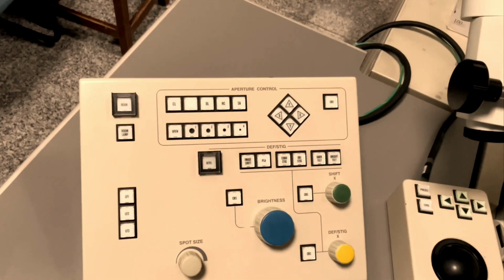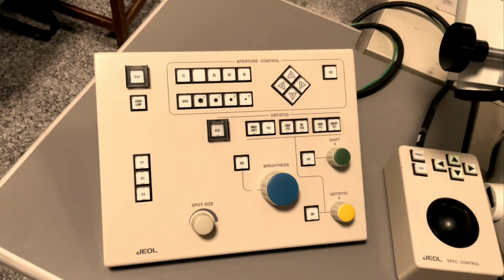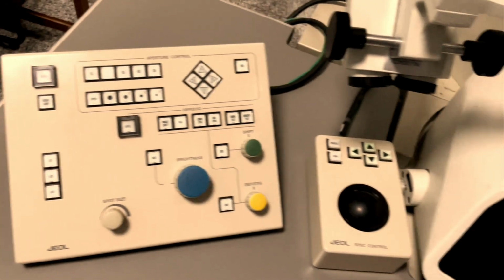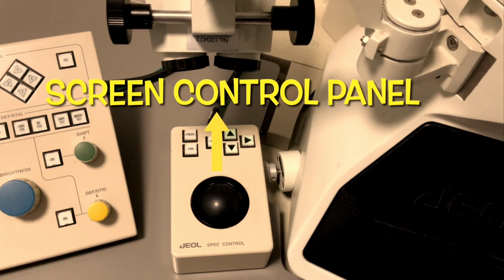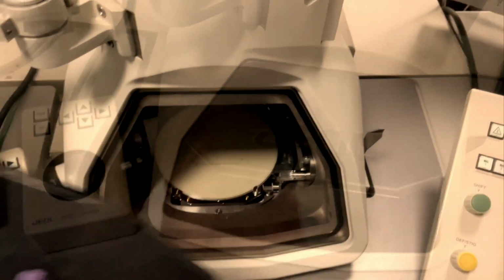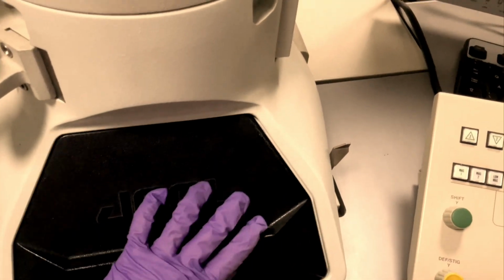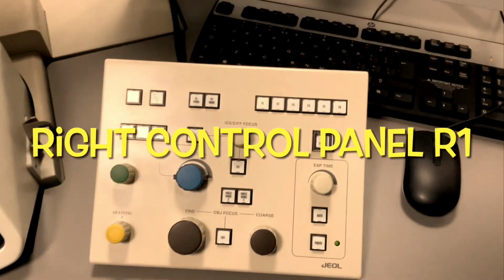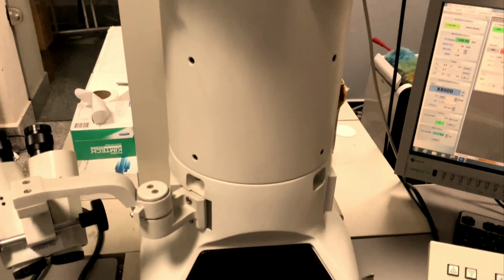This is the left control panel, which is used to control the brightness and other features of the electron beam. This one is the trackball for locating the desired coordinates. This is the viewing screen for direct sample image on the fluorescent screen. This is the right control panel used for the beam correction and magnification.